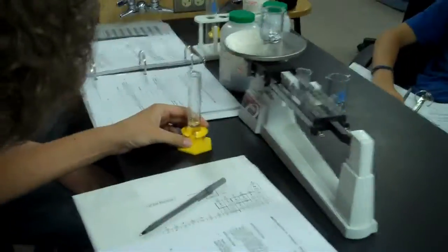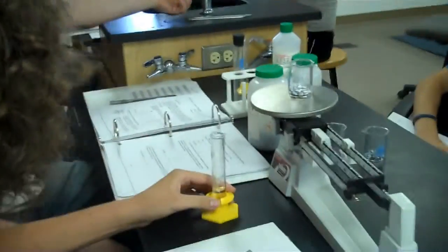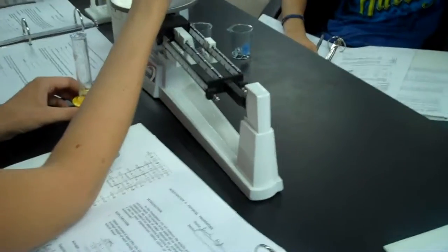Alright. Which one are we going to do first? I'd say this funky looking one, because this one does something. If any of them do anything with the water, then we've got problems. Didn't that do something before? No, that was with hydrochloric acid. We are not mixing it with hydrochloric acid because I did not enjoy almost dying. Okay, so we're doing aluminum first because that's what they picked.